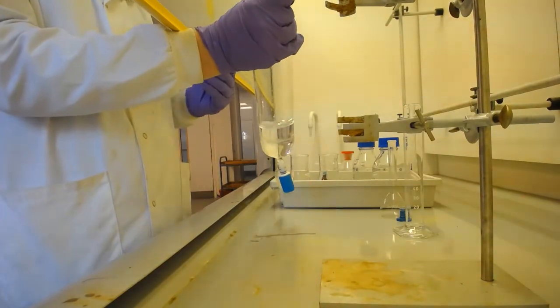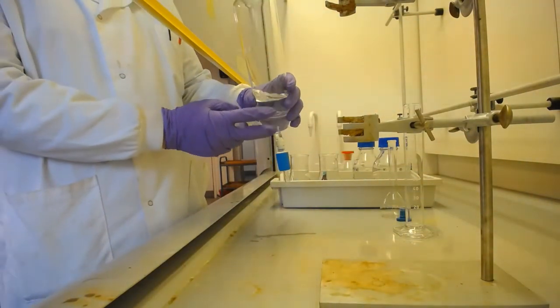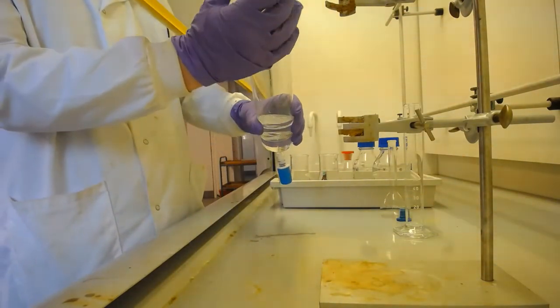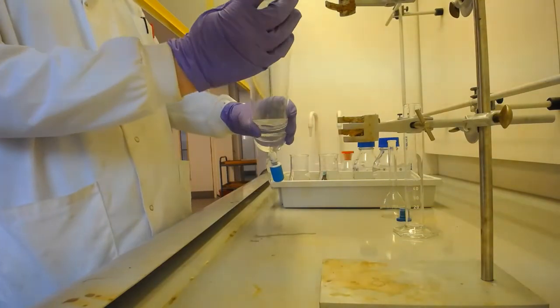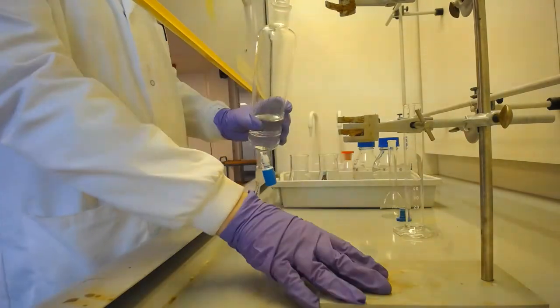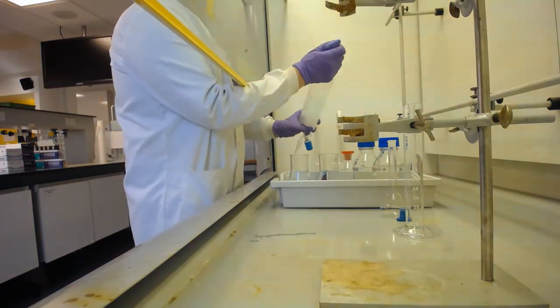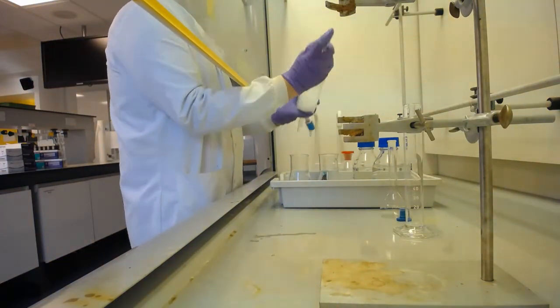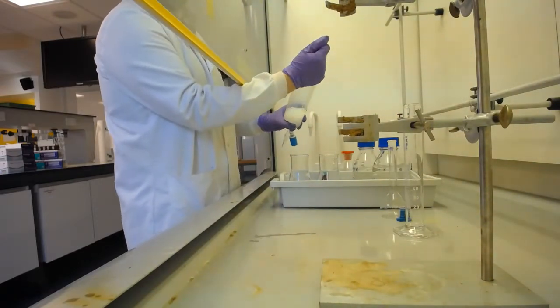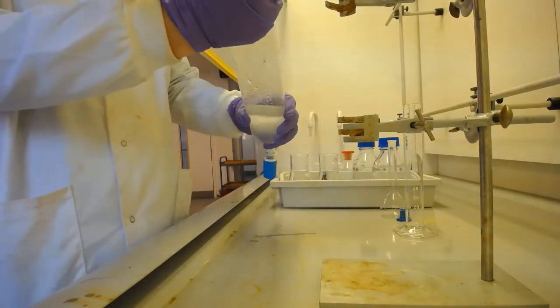Now, I'm going to do this outside of the fume hood, and I'll move the camera so you can see, but when you mix these two solvents, you often find there's an energy change from mixing, because they're not fully mixing, but you're still getting a bit, and you might get an overpressure. So the first shake I'll do may end up popping this stopper off. So before I take this out, I will do a little bit of shake in here first, and then just release any pressure. And it's advisable to do that periodically when you're shaking two immiscible solvents to do a separation or to do a log P.